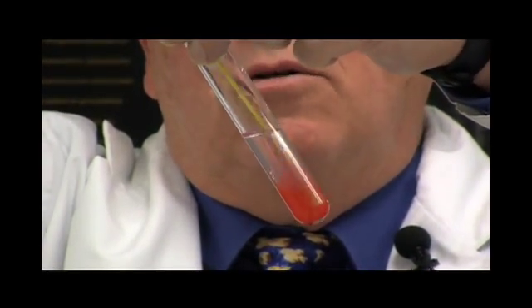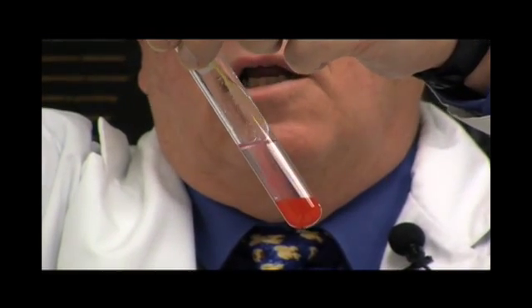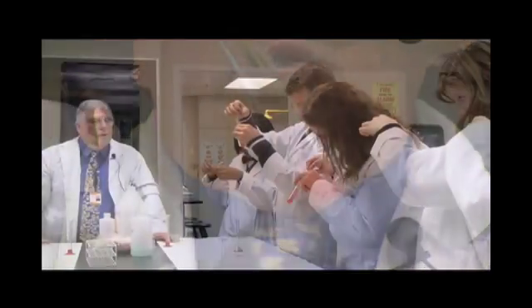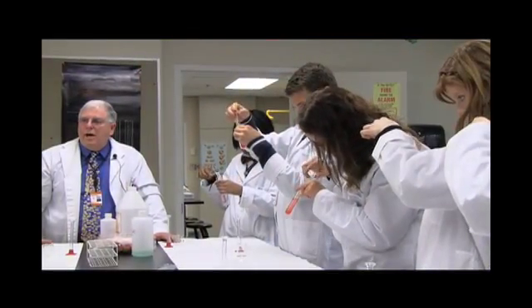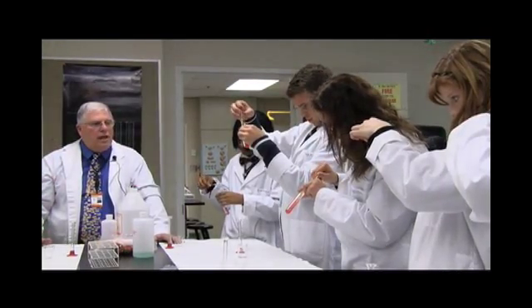Miriam, you're going to continue doing this, what I'm doing. You see how it's coming on the rod? See, look at it. All right, so now you want to take the loop out. Take the loop out and sort of twirl it as you're taking it out so you get the rest of the DNA.